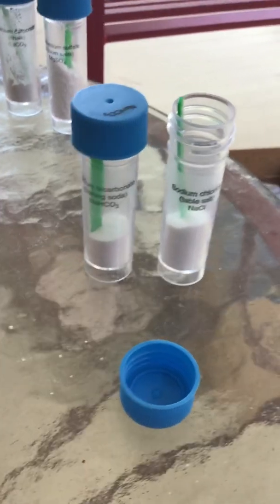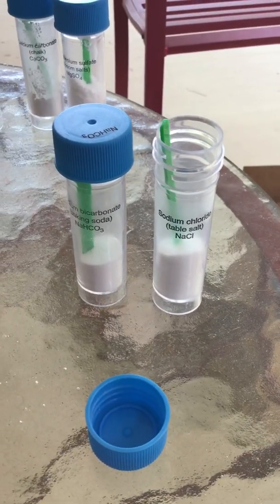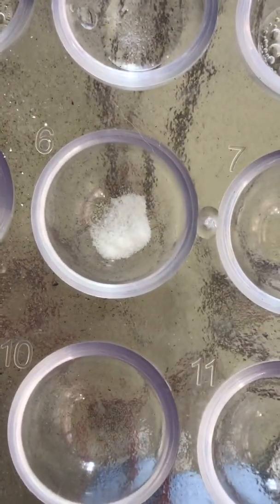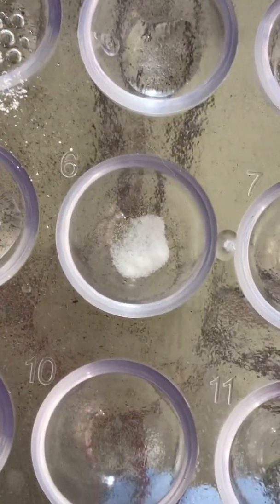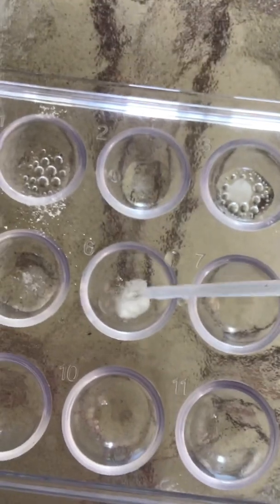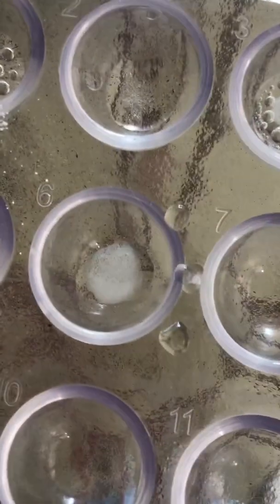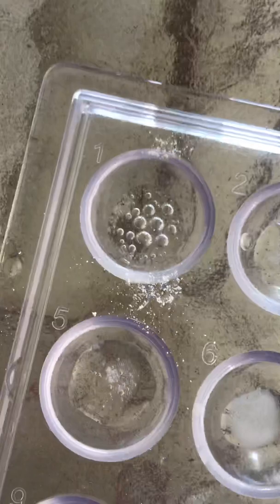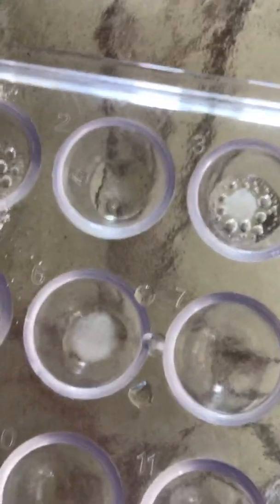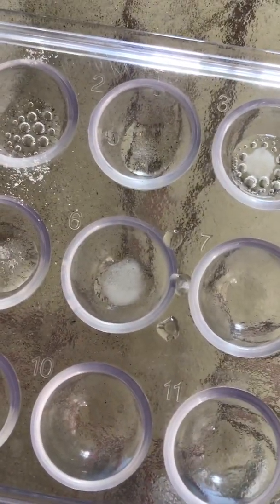I'll try sodium bicarbonate and sodium chloride in well six. Very fine grains. Let's see what happens when I add water. It became very cloudy. Still doesn't look like well one. None of them seem to.